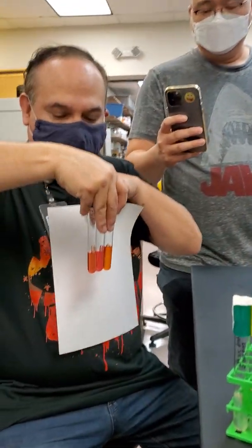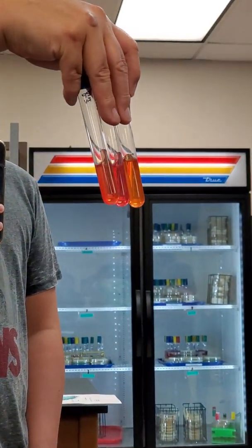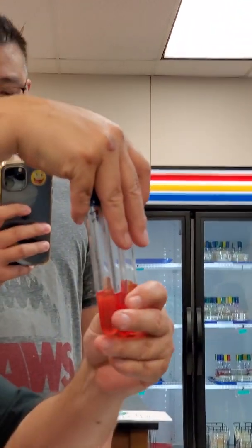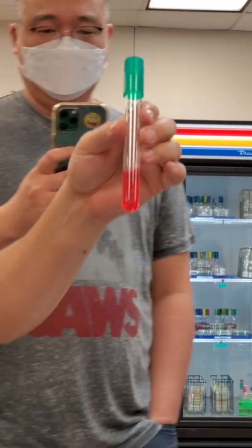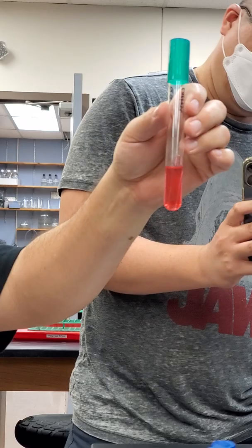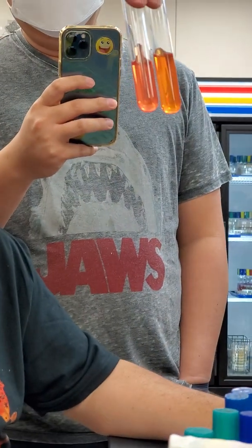See the difference here? They're pretty. So, what can you tell? I think we can all agree that this one is what color? Red. Or pink. Pink, so it's more basic. Now, these two are a little harder, but one of them is a little more yellow than the other. Which one? The one on your left.